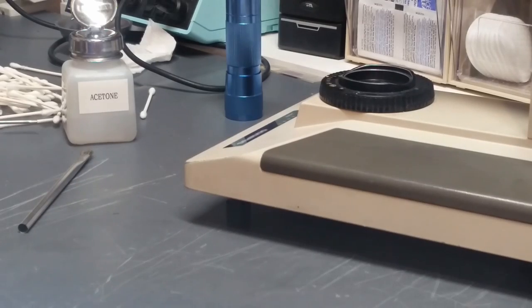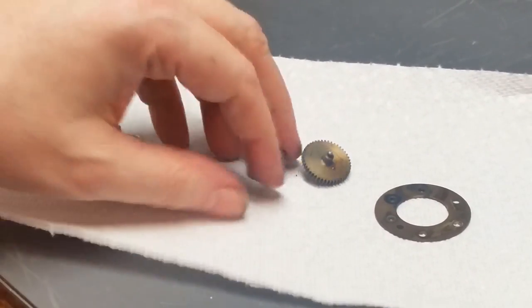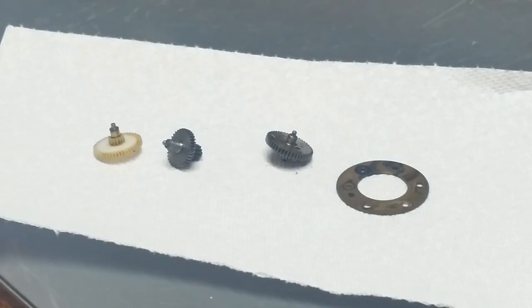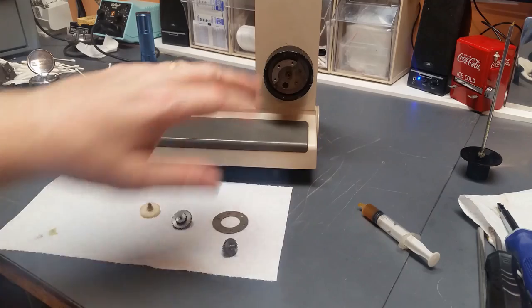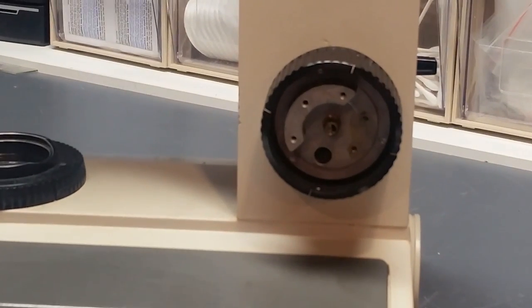I'm going to go off camera. It would help if you could see them. Okay, here we go. All these parts here, I'm going to go off camera and clean them up. I'll be right back. Okay, these parts are clean and ready to go in. So let's get her done.